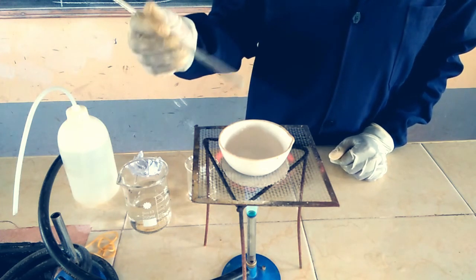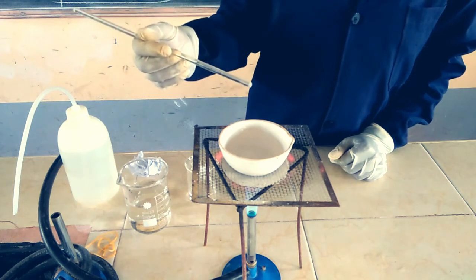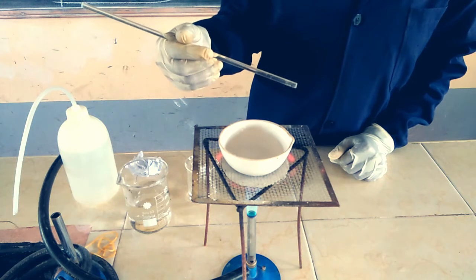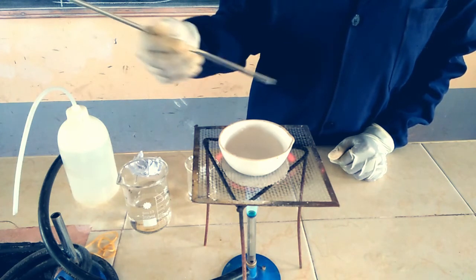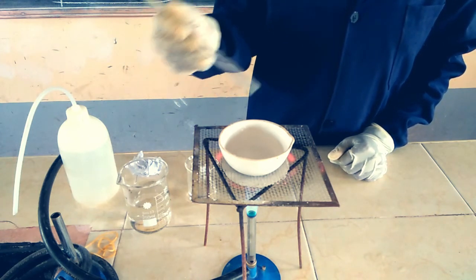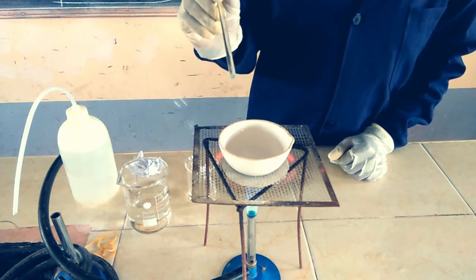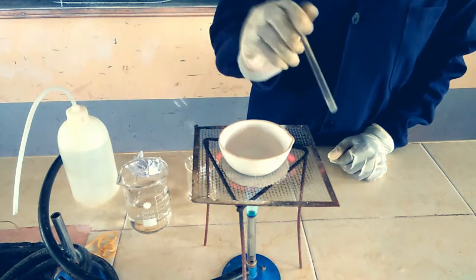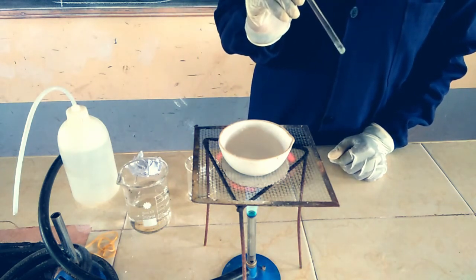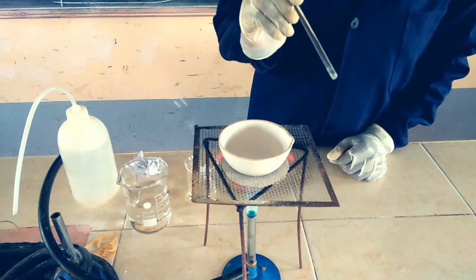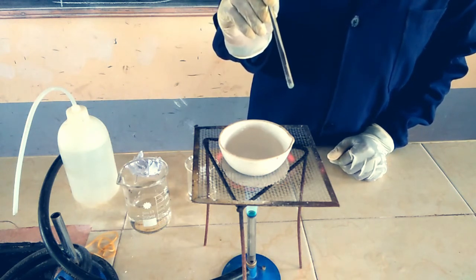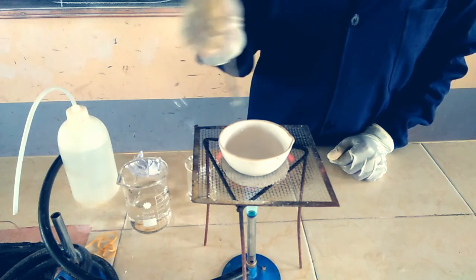Our salt is ready. You can see there's some sign of the spitting happening. The salt is just about to form, the spitting out is evident. You can see there's some salt jumping out of the evaporating basin. Of course, the correct word is spitting out.